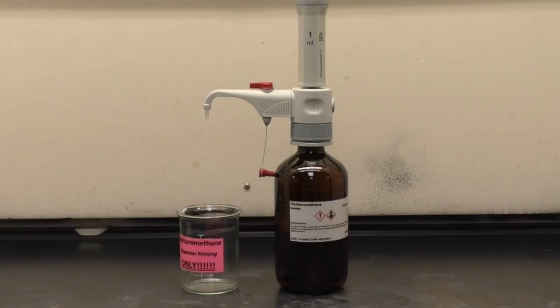Before use, make sure the cap has been removed and the valve on the pump is in line with the spout. If the pump is not ready for use, please inform your instructor.